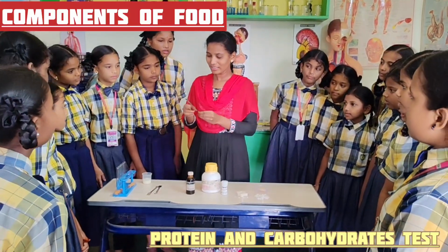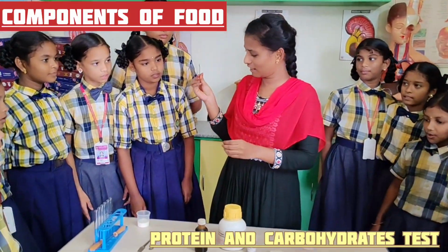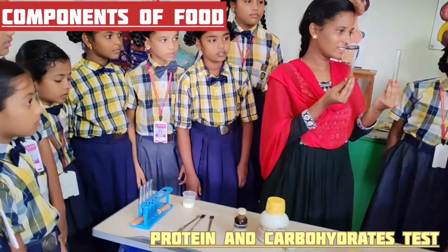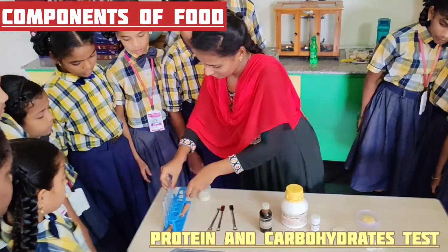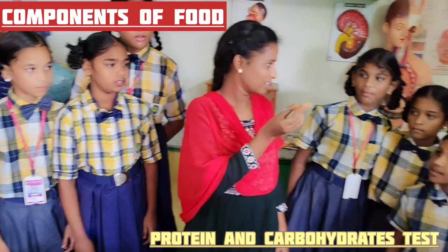What is it called? This is a spatula. Observe this one. This is a spatula. And these are test tubes. Observe. These are test tubes. What is it? This is a dropper.